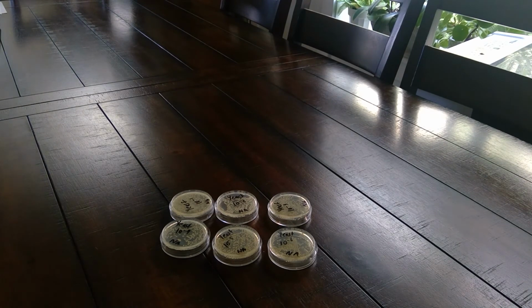Then step 27 says take a photo of each developed dilution plate and insert the images into photo 1 through photo 6. Step 28, record the count data for each plate in data table 1. Identify plates as viable, too numerous to count, or too few to count, based on the criteria in step 2 presented in the background. Step 29, complete data table 2 to calculate the number of CFUs in the original sample. Use information from your least diluted viable plate for the calculations. For example, if you have 3 countable plates with 250, 100, and 40, you would select the 250 colony plate for data table 2.